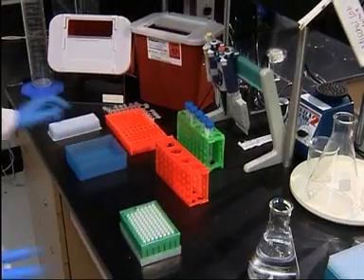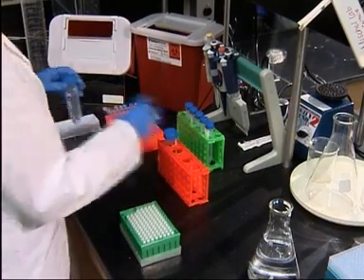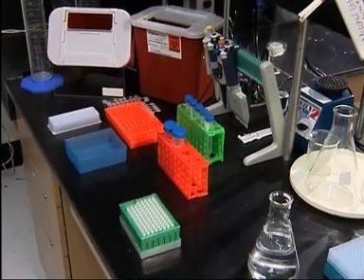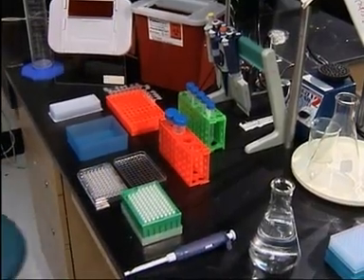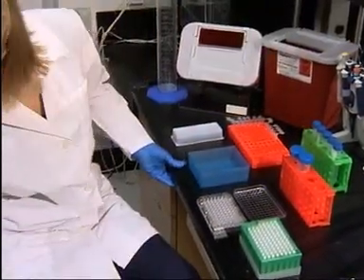This video will demonstrate some simple ways to set up your laboratory workspace so you can work safely and efficiently. You will learn how to position your work materials and what you may be doing right or wrong when using your pipette. So stay put, because the following few minutes could save you a lifetime of discomfort.